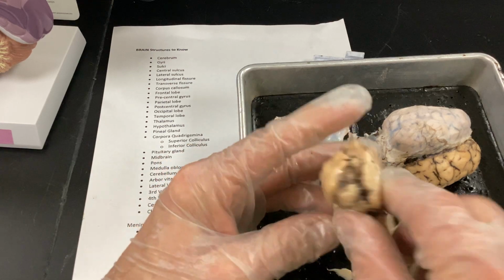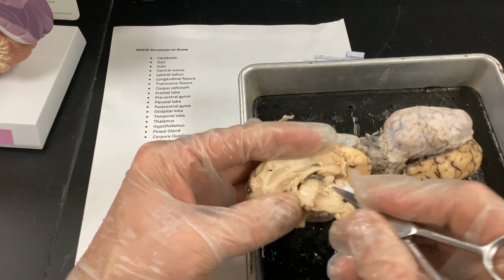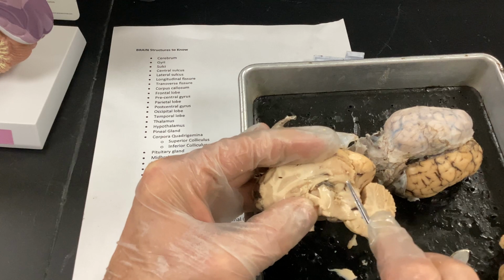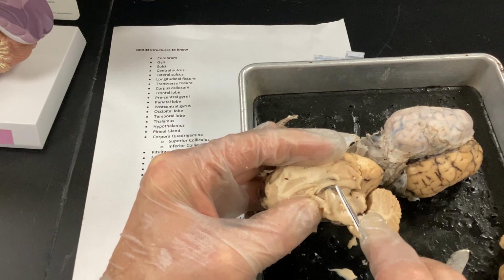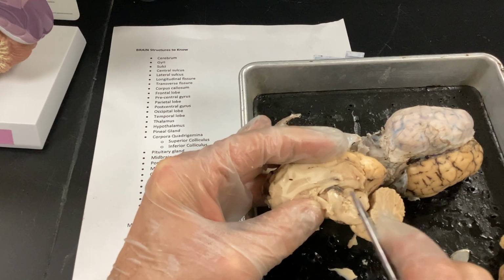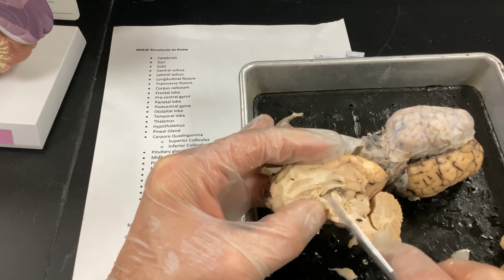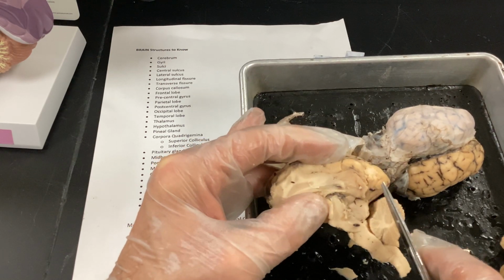Corpus callosum, remember, if I can find it on here, is literally going to be this area here. And you see how it's white? And this is what connects the left and right side of the brain. All right. So they used to sever this if somebody had a severe, like, grand mal seizures constantly. They would disconnect that because it would fire both sides of the brain at the same time. That's when people go into convulsions and things. And you can look on YouTube, there's documentation of videos of people that they've cut this, all right? And they literally have different interpretations of different things because the left and the right side of the brain don't communicate with each other. So that's kind of interesting to watch.